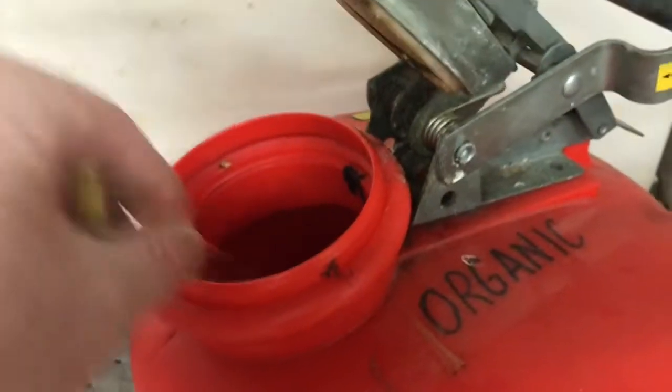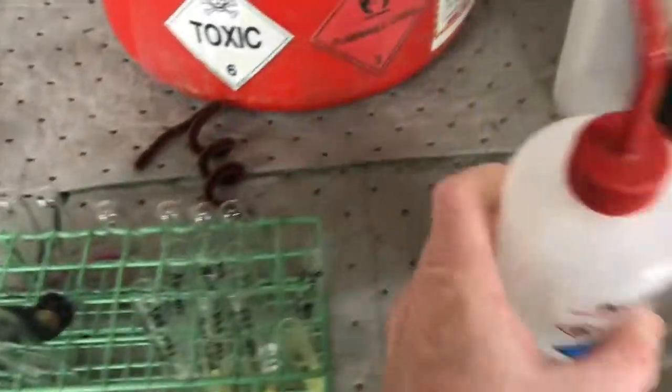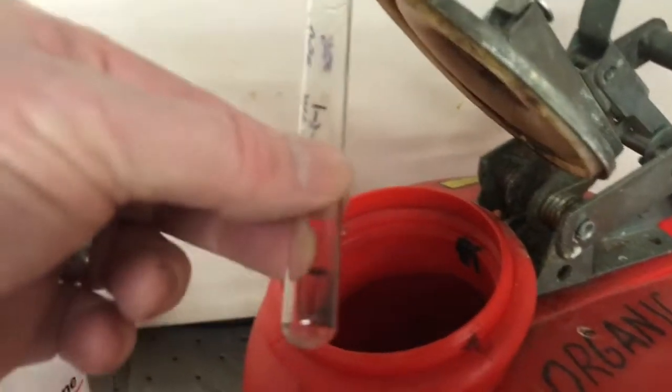Dump that in the waste container. Most of the solids stay on the bottom. So let's try to get that out with the acetone. This is something we can't put down the sink drain at all, dibenzoyl ethylene. So let's clear that up. Dumped it kind of fast.